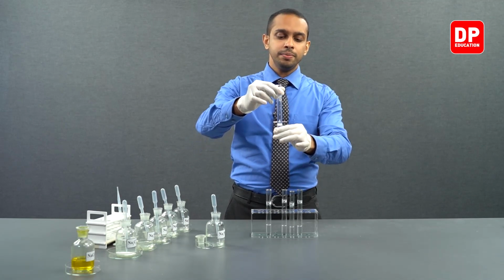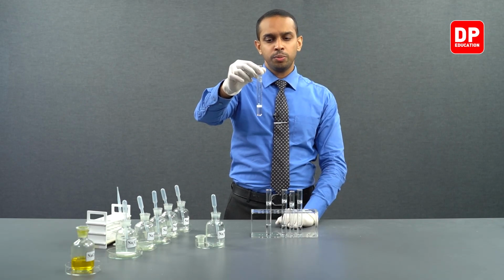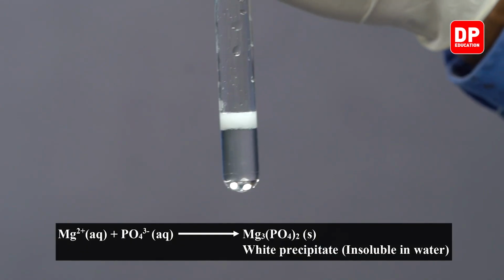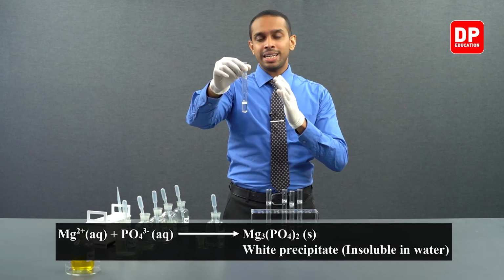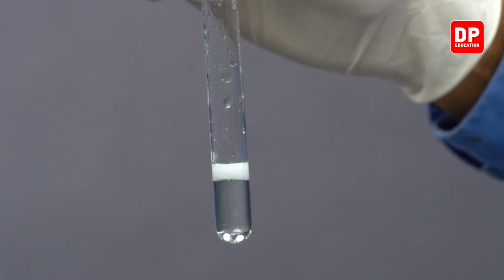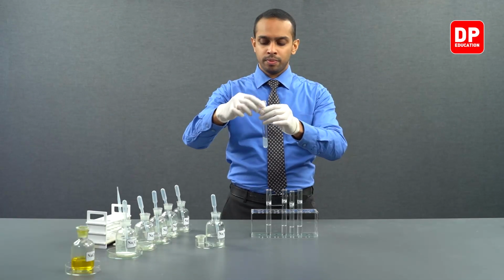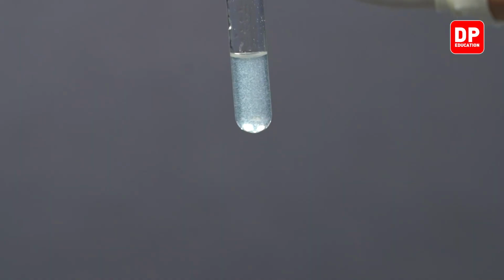Now you can see here, when I started adding phosphate ion solution to magnesium, immediately a white color precipitate was starting to form. What you see here is magnesium phosphate. When magnesium ions come into contact with phosphate ions, it forms a white color precipitate, magnesium phosphate. Let's add a few more drops to see the precipitate clearly.